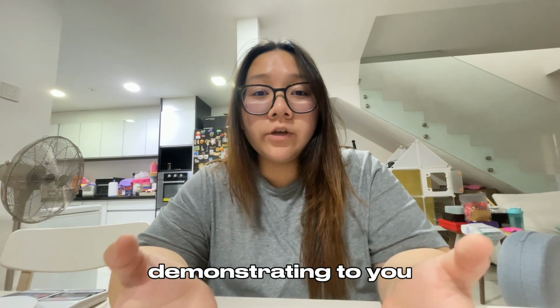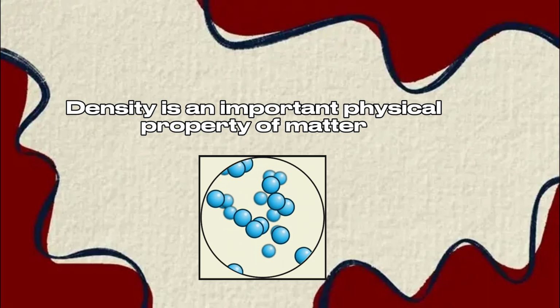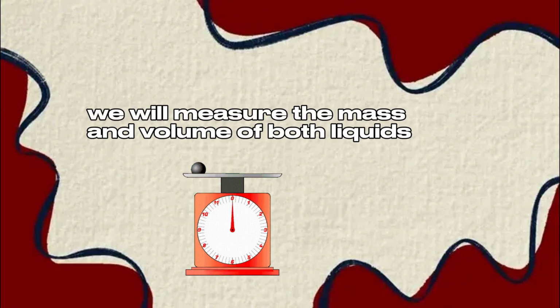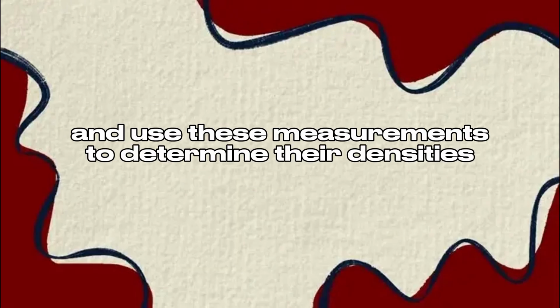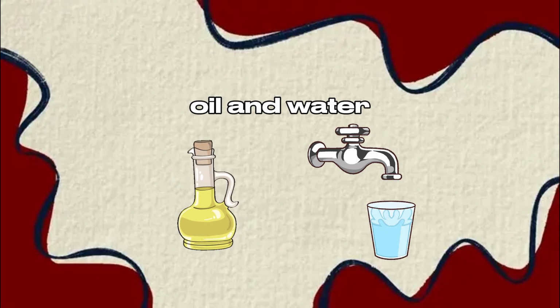Hi, I'm Kyrie, and we will be demonstrating to you how to measure liquid densities. Firstly, density is an important physical property of matter that describes how much mass is contained within a certain volume. In this experiment, we will measure the mass and volume of both liquids and use these measurements to determine their densities. Then, we will compare the results to observe the difference between oil and water.